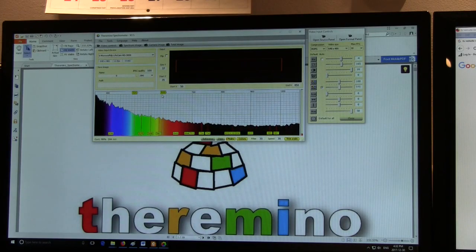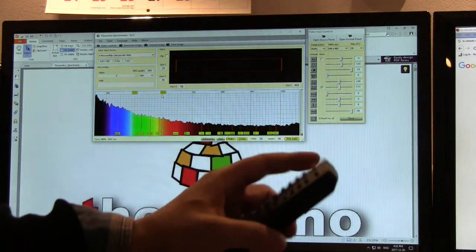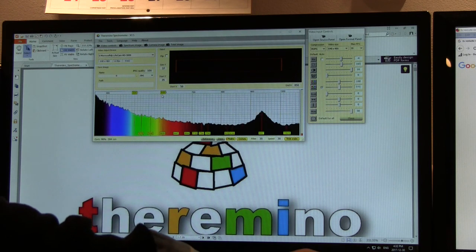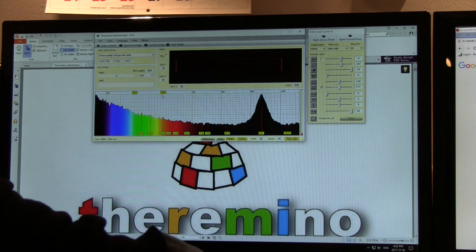One final thing I wanted to show was how this device can be used to actually look at light that you can't see with the naked eye, like, for instance, infrared lasers or even remote controls. So I've got a couple of remote controls here that I've just been playing around with, and I'm just going to try and see if I can pick up the signal from one of these. And I haven't calibrated this, but you can see if I just point the remote at the slit, we can see that it's coming in. I guess this one's probably around 940 nanometers. That's around about where we are on the thing.